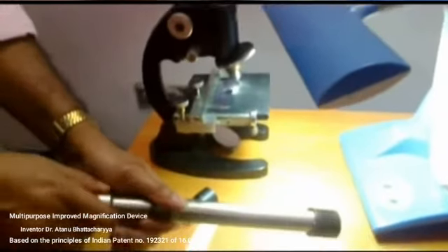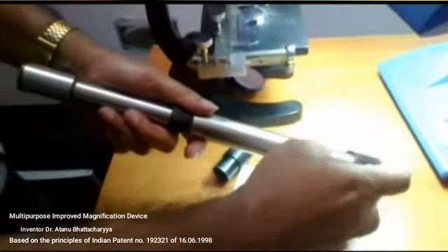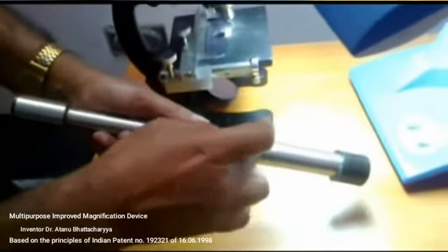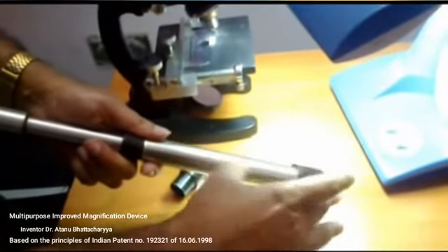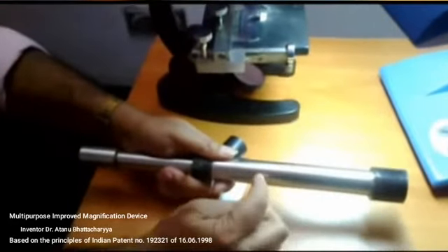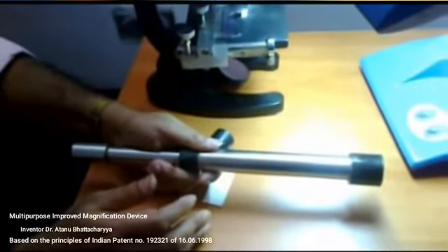If I now pull the T1 tube much more, then this objective makes the image here. That means the image is formed after 2f distance. 5 centimeter is f distance, 10 centimeter is 2f distance, and if the image is formed at the 12 centimeter or 11 centimeter position, then the magnification of the image becomes higher, that is more than 1. If it makes 1.25 magnified image here, then that magnification is again magnified 40 times, so that about 50 times magnification can be achieved here.